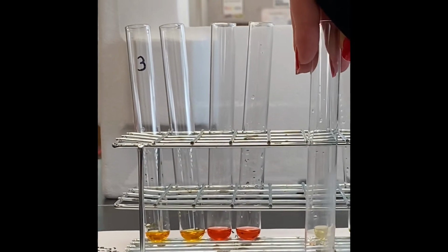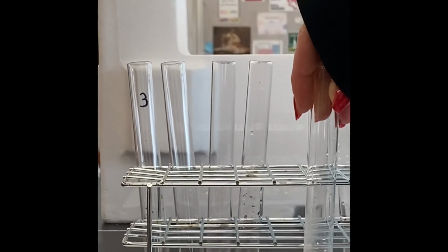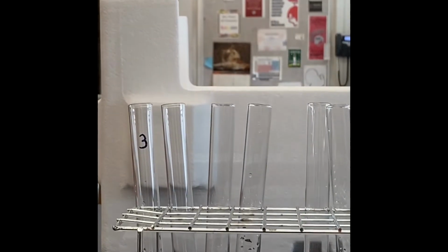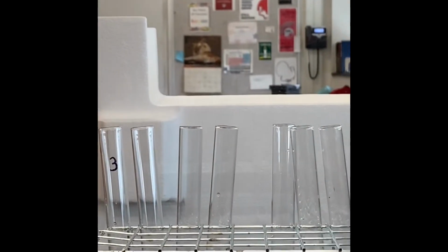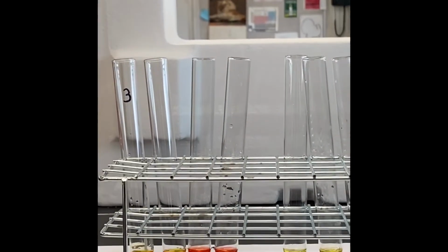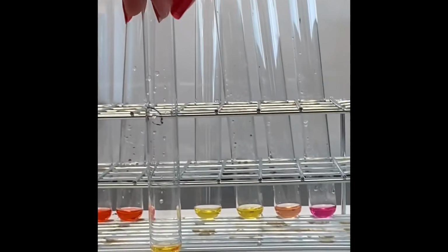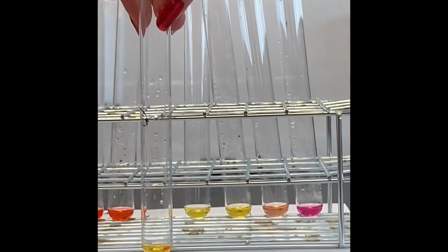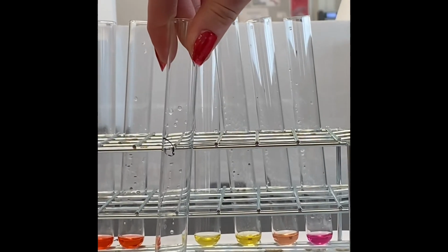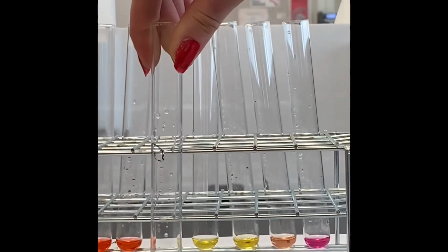So it's not quite as red as the third one, but it's definitely more red than the second one. So we're going to call that 0.005 because it's in between the two. Okay? Miranda just wrote that down. So now we'll do the orange 4. So this is acetic acid, 0.1 molar with orange 4. So again, a little less yellow than the first one or the second one, but definitely not as orange as the third one. So we'll call it 0.005 again.